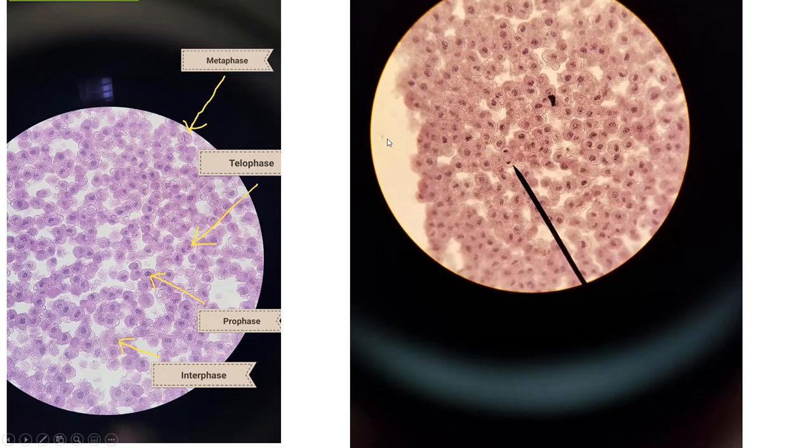And then looking through the microscope at these phases, one of the lab activities that we do is look at fish mitosis, where these cells divide really quickly. So if you take a snapshot at any point in time, you see a bunch of different phases of mitosis. So some of them are labeled right here. So you can see metaphase right here. The chromosomes going across the middle of the cell. Here's telophase, where you see the two separate cells forming.